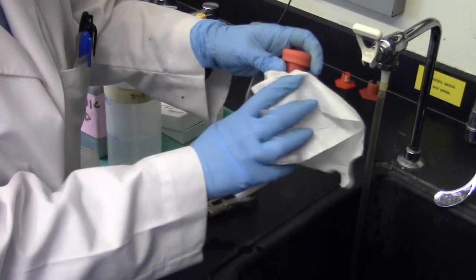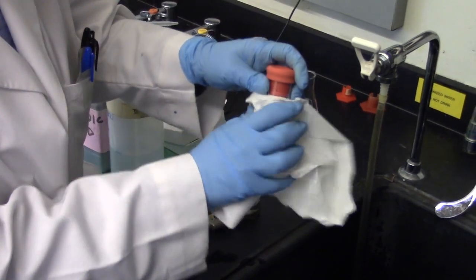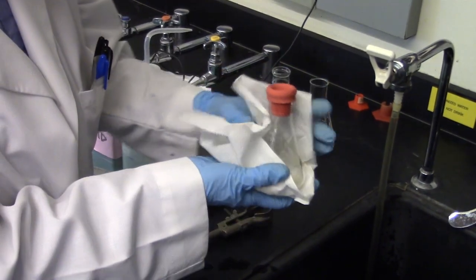Dry the outside of the flask well with a paper towel, making sure that you also dry around the edges of the septum.